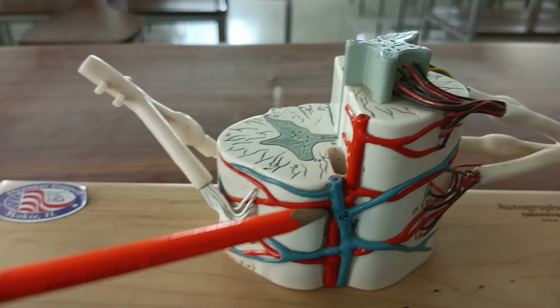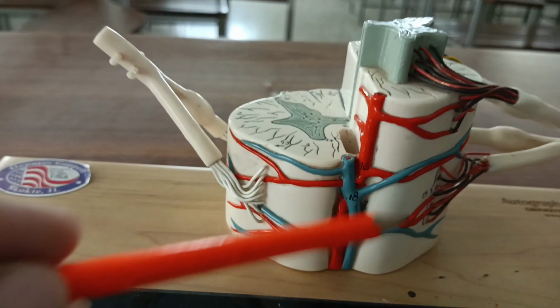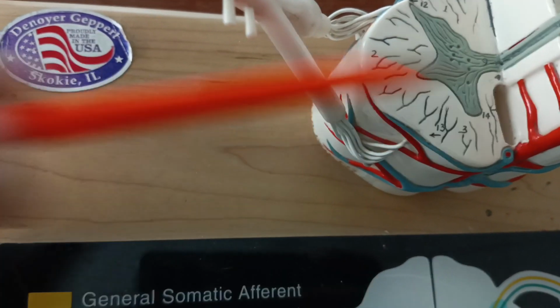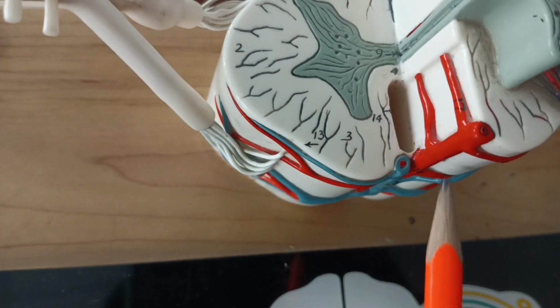And concentrate on the vessels. These are the anterior spinal vessels and they have ramifications. And if you concentrate inside, there is the sulcal artery running, right? These are the sulcal branches of this anterior spinal artery.